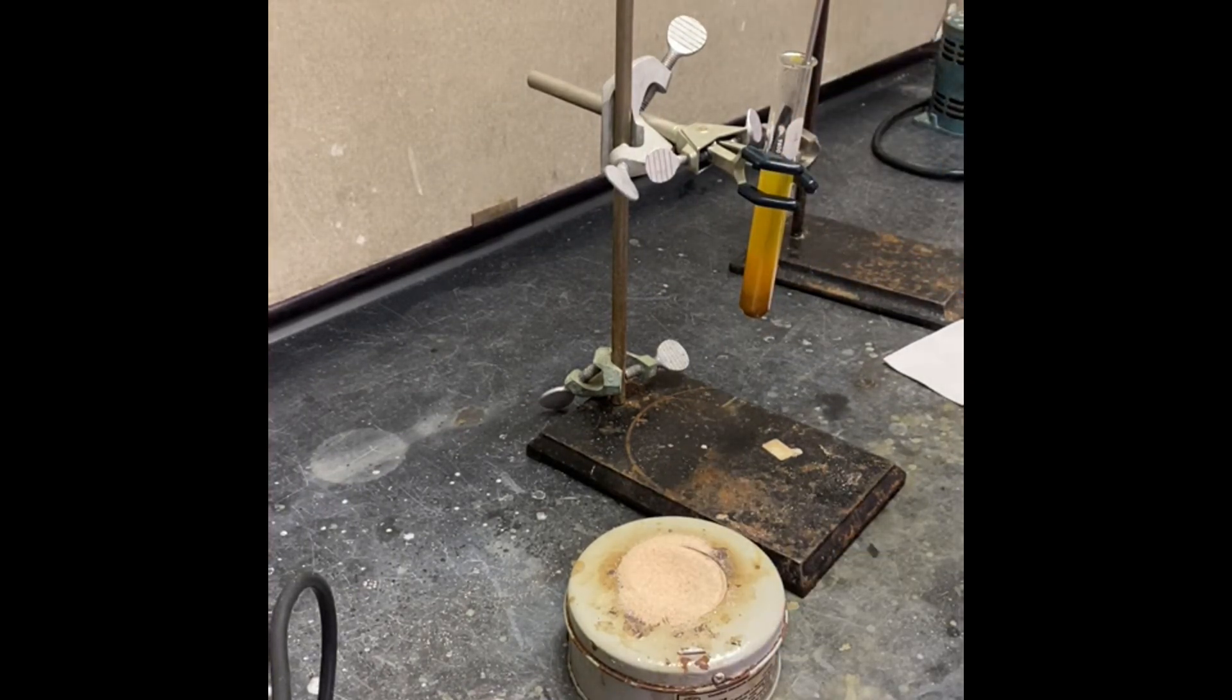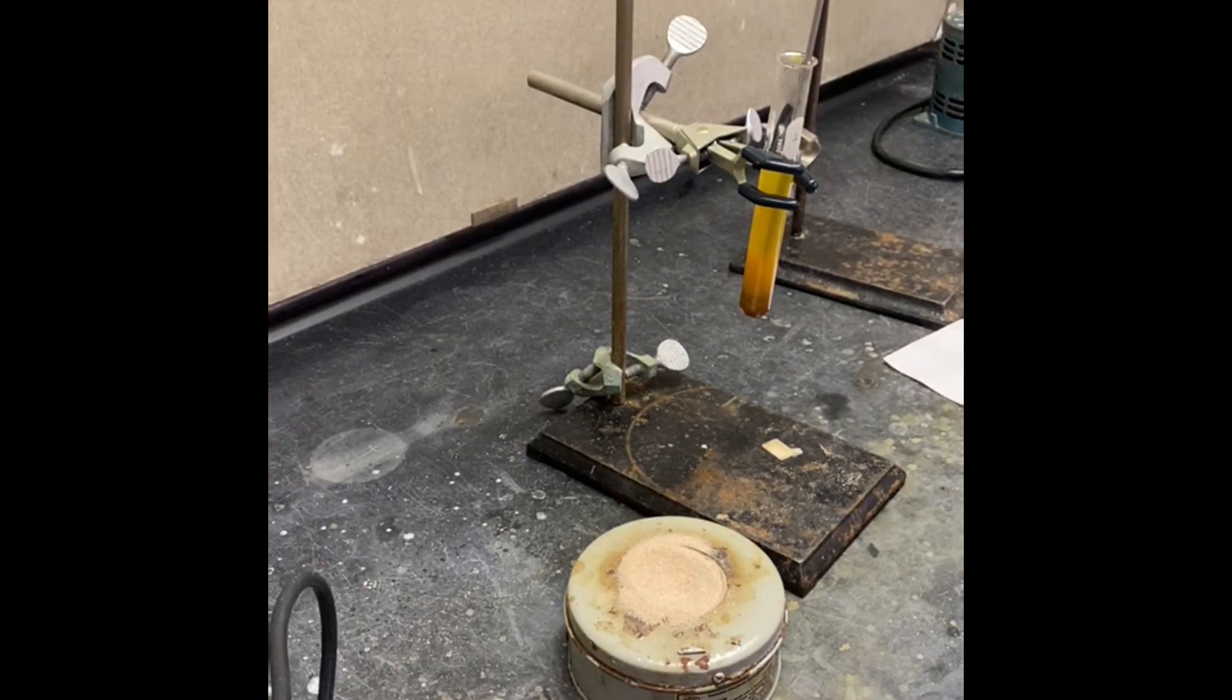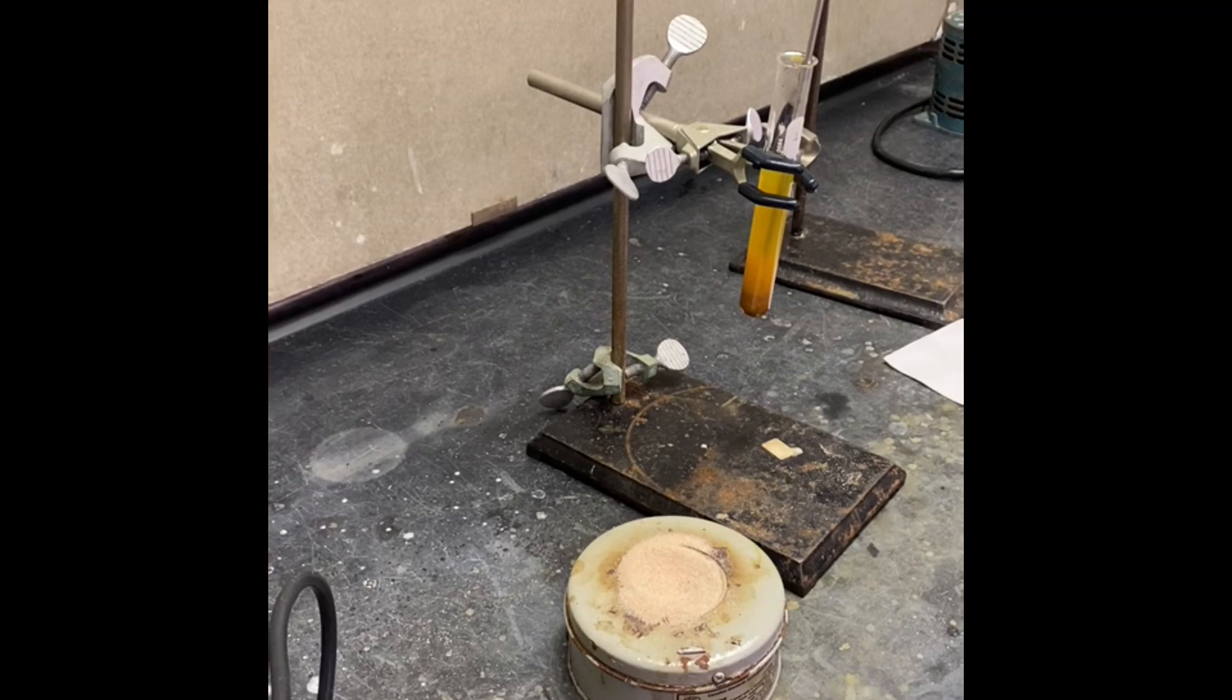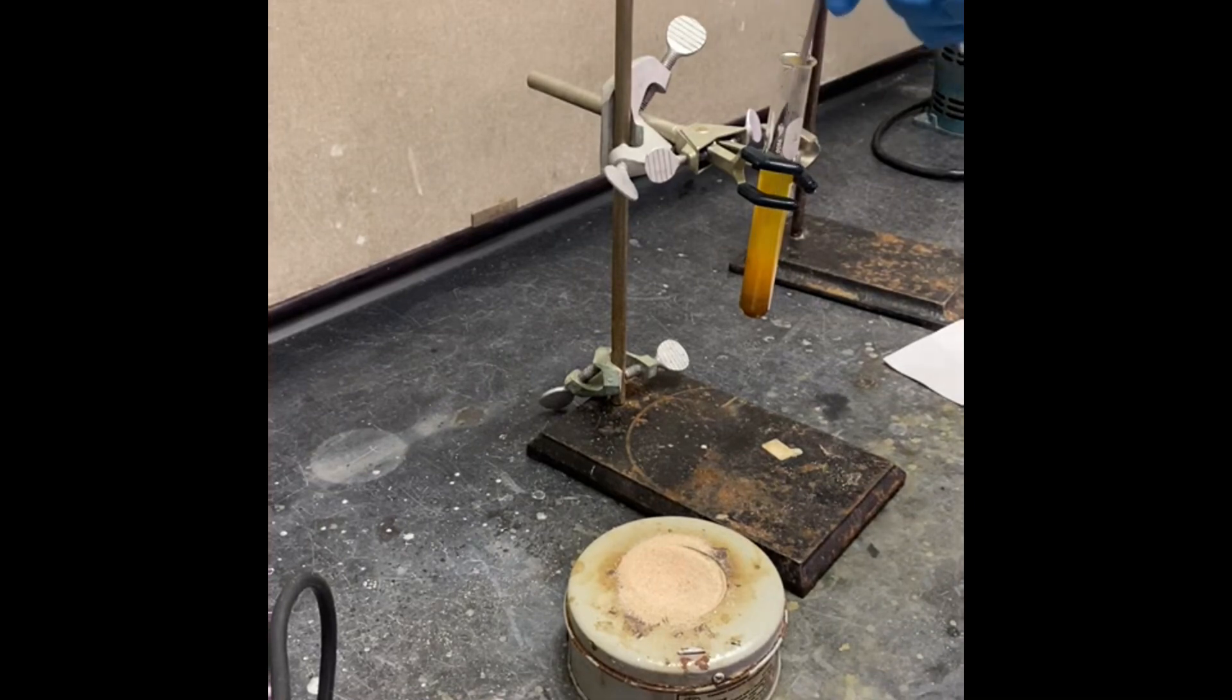With cold water or tap water, you can do that too, but we don't want to waste too much water, that's why we are going to use the stirring rod.